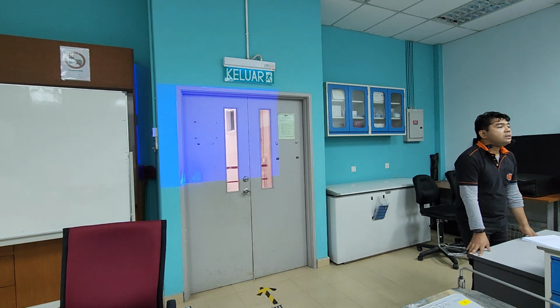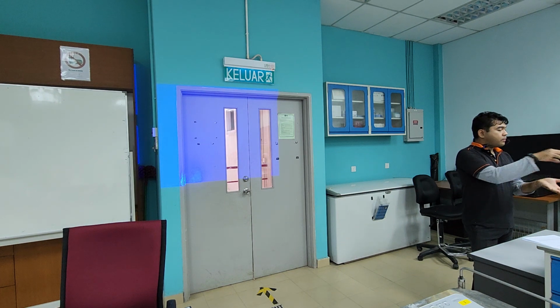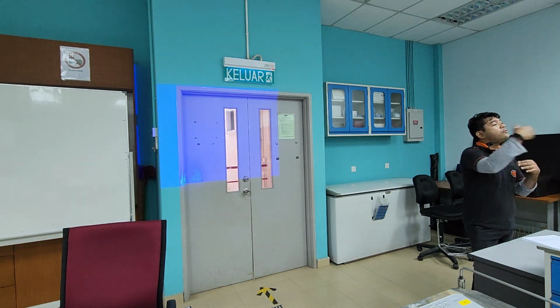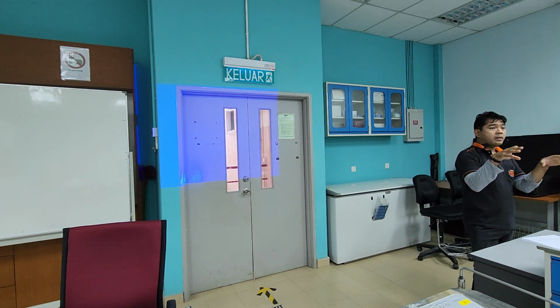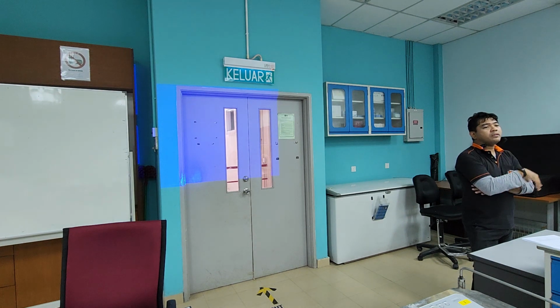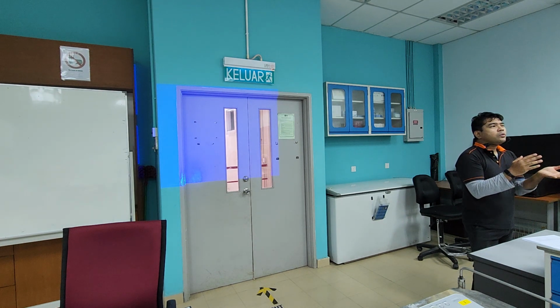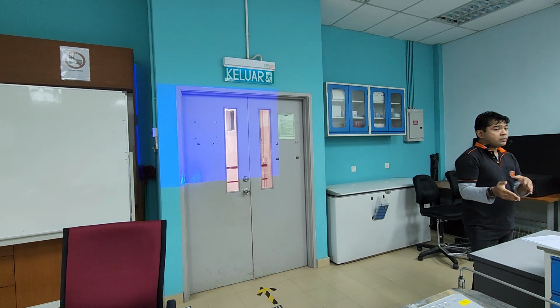So this growth analysis, actually it requires several weeks because you need to wait for your seeds to germinate and grow before you can collect the organs for 2 weeks. Remember your growth analysis formula? There's T1 and T2. So that T2 is the second week. T1 is the first week after your plants have grown. So I expect the experiment going to take about maybe 3 weeks. Yeah, so this week you grow, and next week we see whether it's big enough or not.